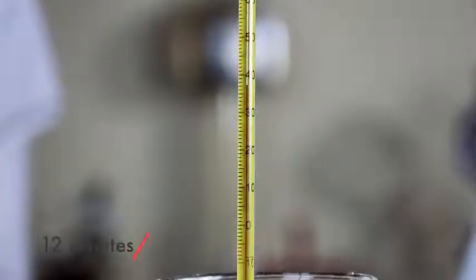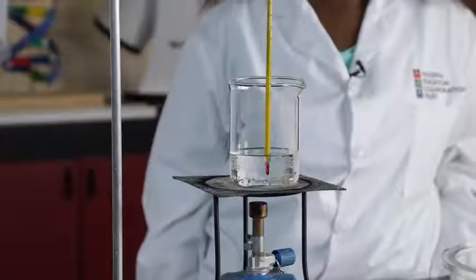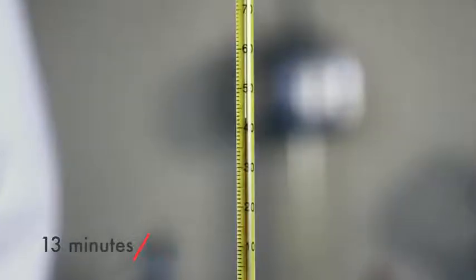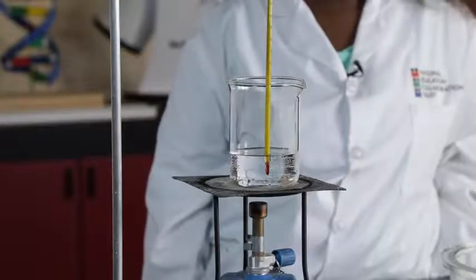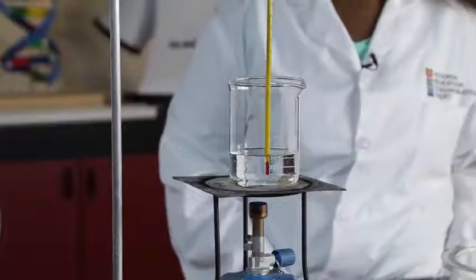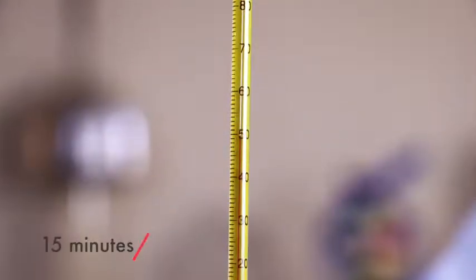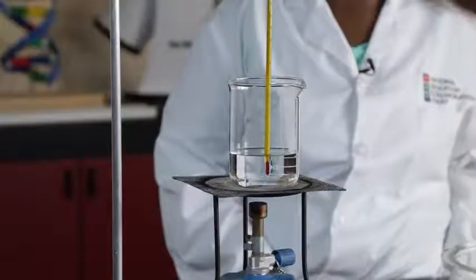This is a thermometer reading at 12 minutes. Write it down yourself. This is what the beaker looked like at 12 minutes. This is a thermometer reading at 13 minutes. Write it down yourself. This is what the beaker looked like at 13 minutes. This is a thermometer reading at 14 minutes. Write it down yourself. This is what the beaker looked like at 14 minutes. This is a thermometer reading at 15 minutes. Write it down yourself. This is what the beaker looked like at 15 minutes.